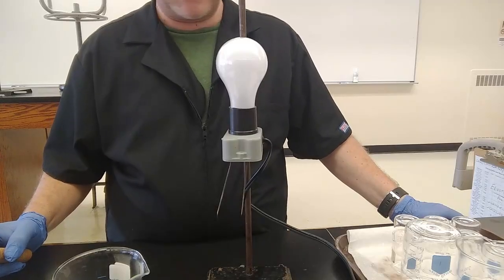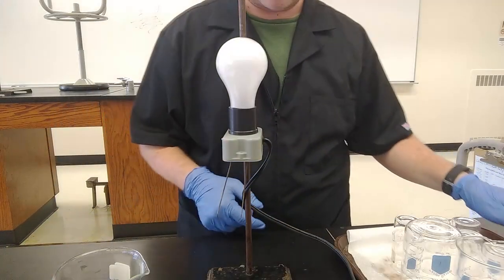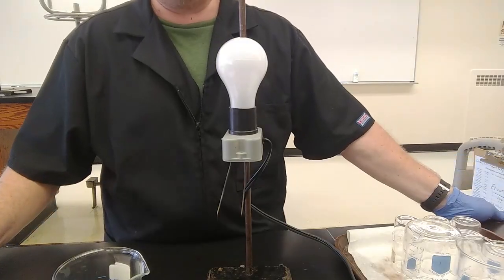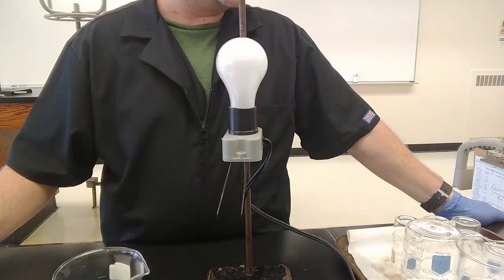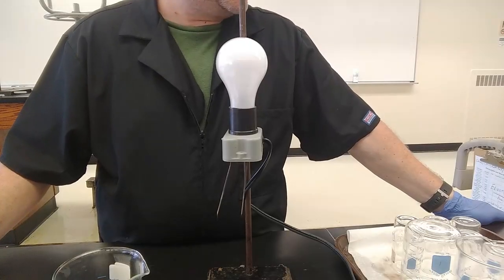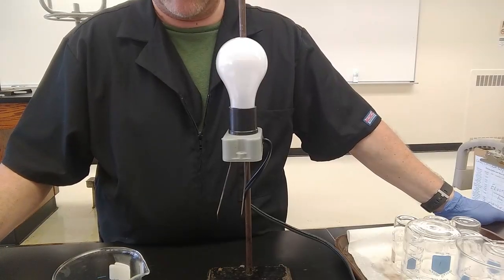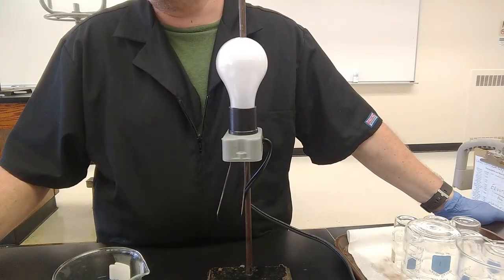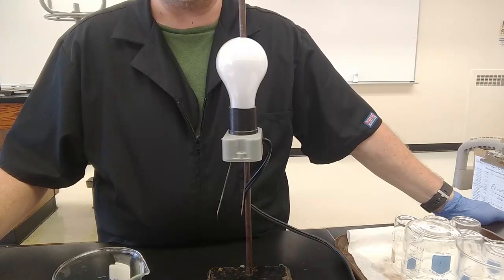Now, usually I like to get a variety of different solutions. I ask my son for a urine sample. He always likes peeing in a beaker for me. And we test that, and I test Gatorade and diet soda and regular soda. And I don't have any of that stuff with me today. So we'll just do the things on the list. And I apologize for that.